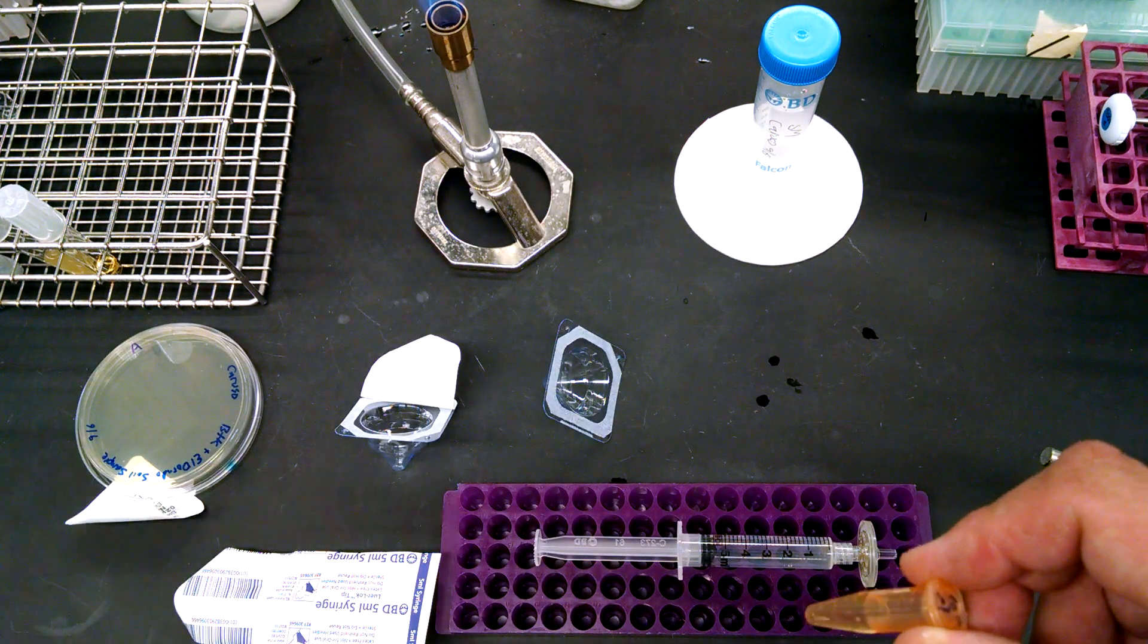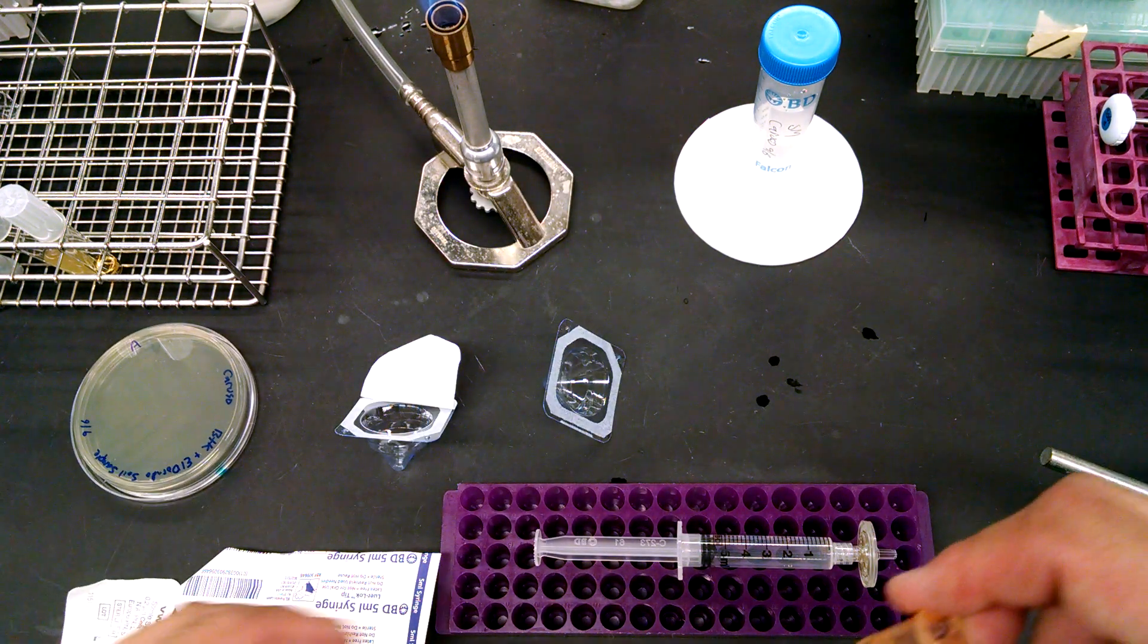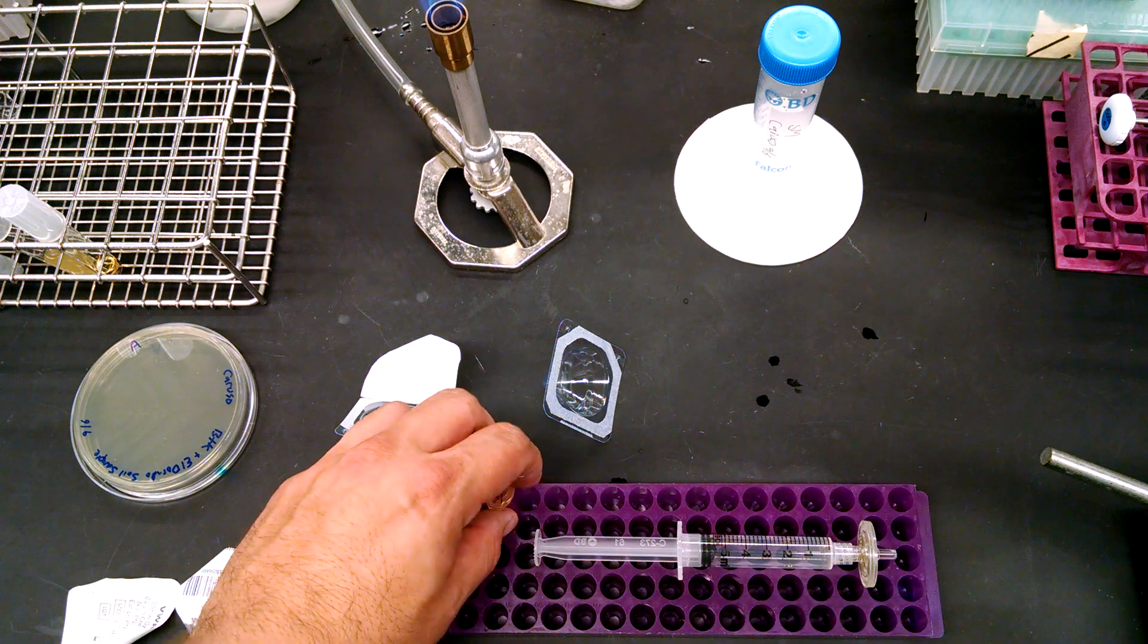And if we get plaques, we're off to the races. That is the way you test your direct sample.